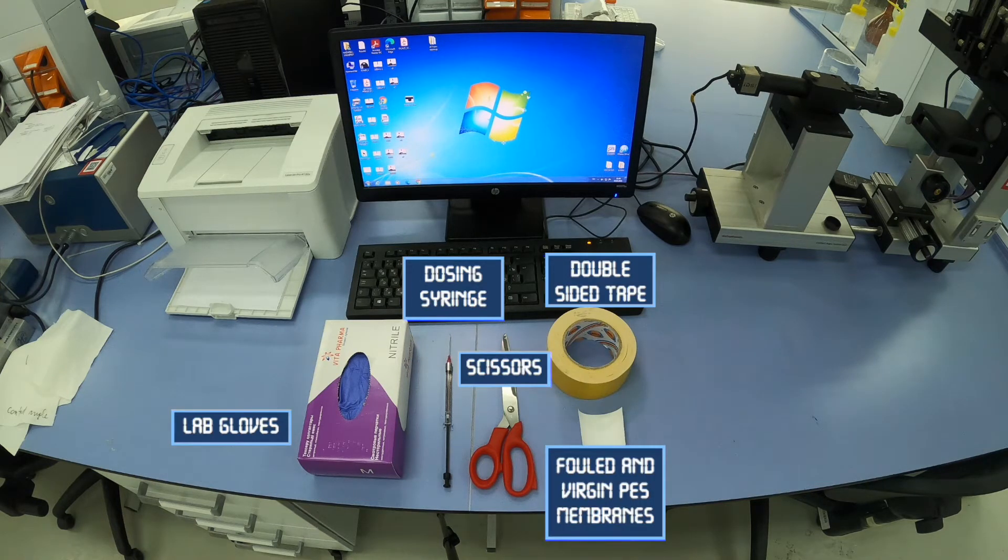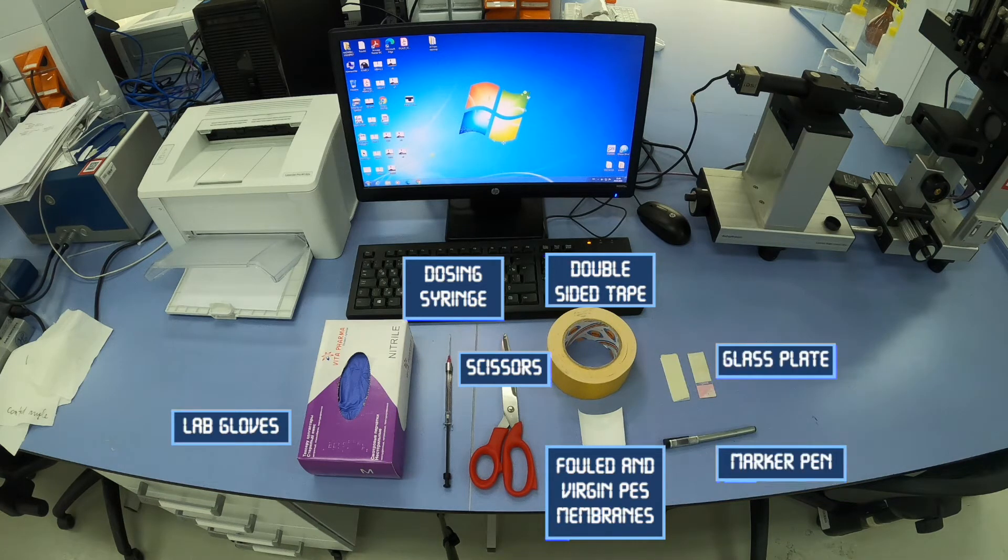fouled PES membrane from the first laboratory work, a new virgin PES membrane, glass plates and marker pen.